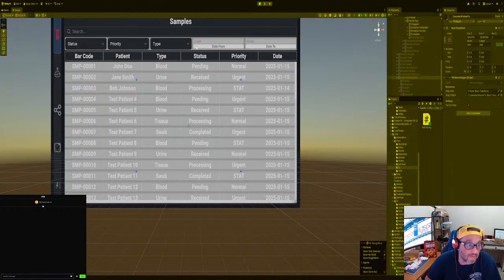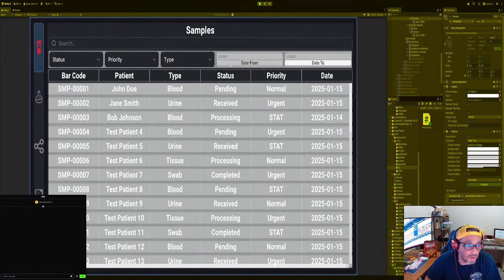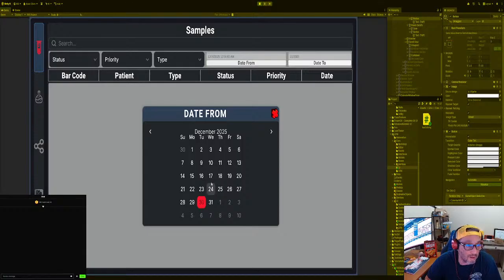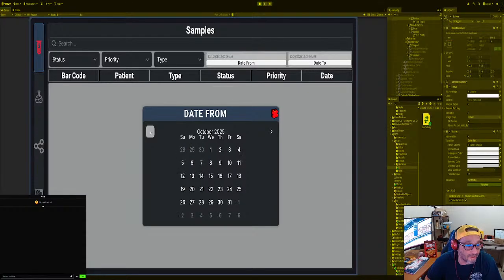All right, so we go from 1970 to 26, right? So we want to go, oh, sorry. We want to go from here, from, okay, so it's working, to, oh, here. All right, December, right? So is that working? No, not really. So we're going to click to 1924, I mean to 2024, and see if that works.